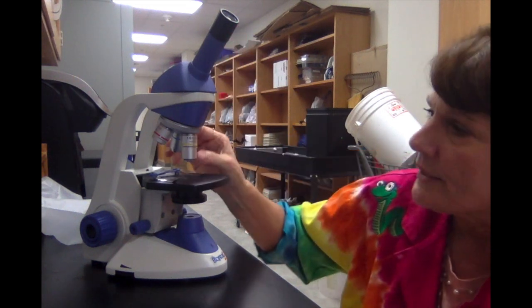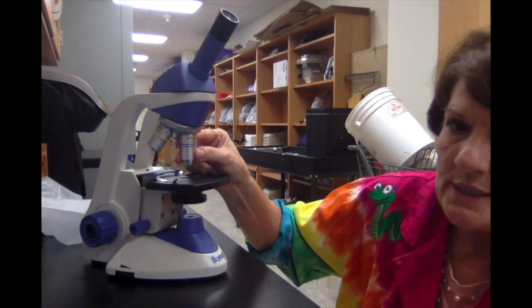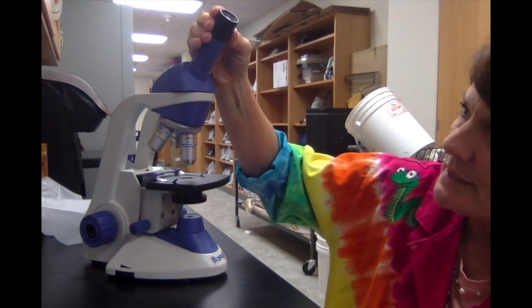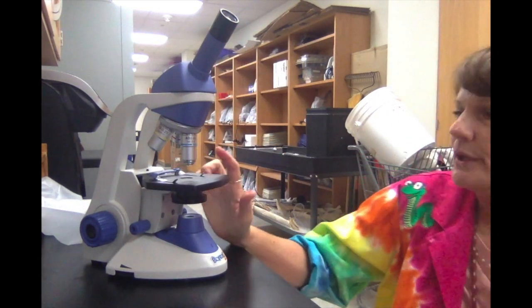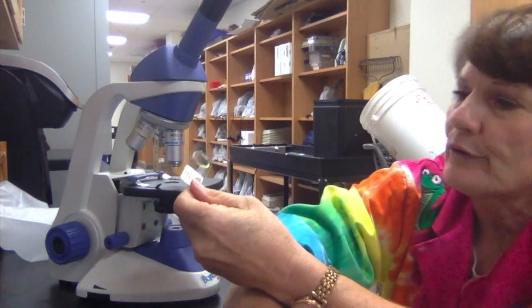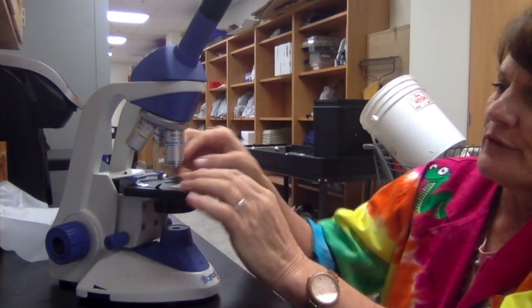from these two. Then finally, when we go to the largest objective, these are objectives, this one is at 40 times magnification, and we can multiply it times the eyepiece of 10, and we end up with a 400 times magnification with those two. So we typically put our specimens on this stage right here. So if we have a slide that we put on the stage, this place is the stage where everything is going to be viewed from.